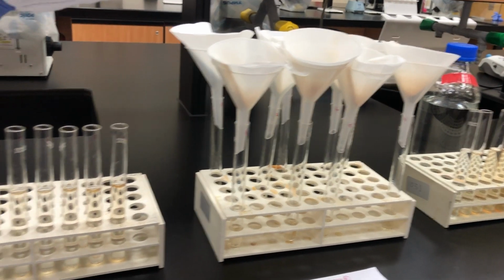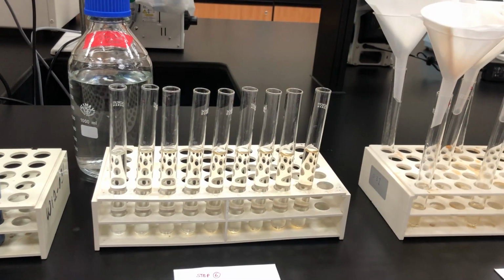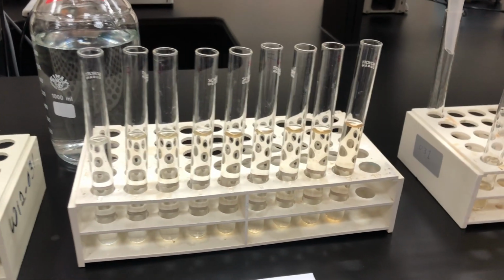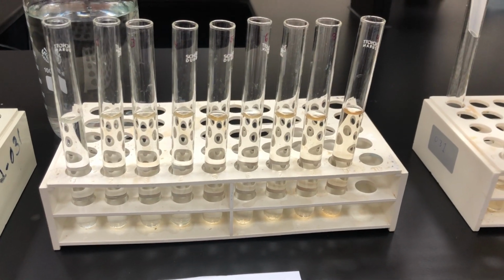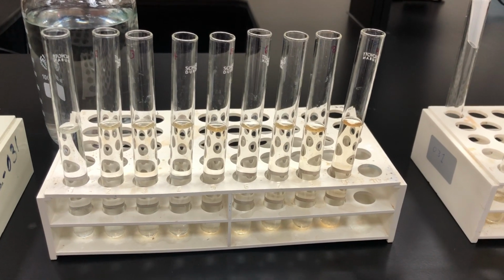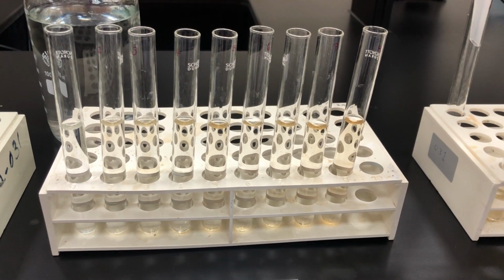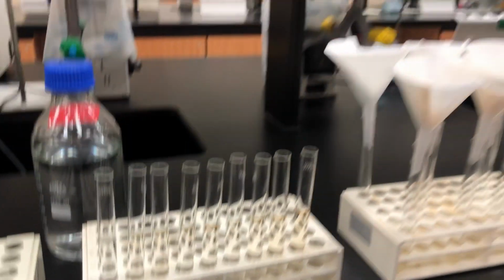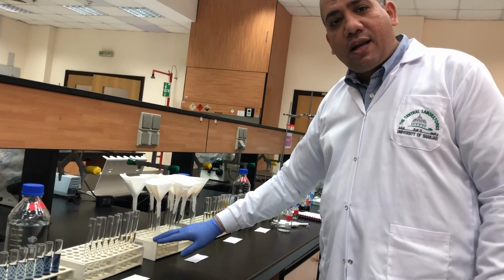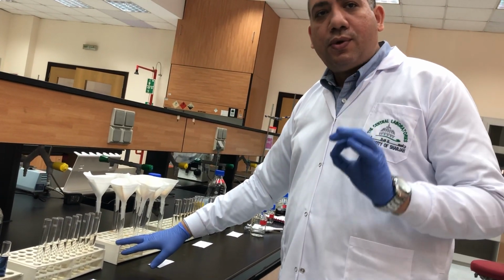So I will again have 9 tubes with the filtration. In this step, I will have polypeptide because I added protein in acidic media with pepsin. That means I will get polypeptide. I precipitate all the remaining protein, so what remains in the supernatant will be polypeptide. So the filtration here will contain your polypeptide.